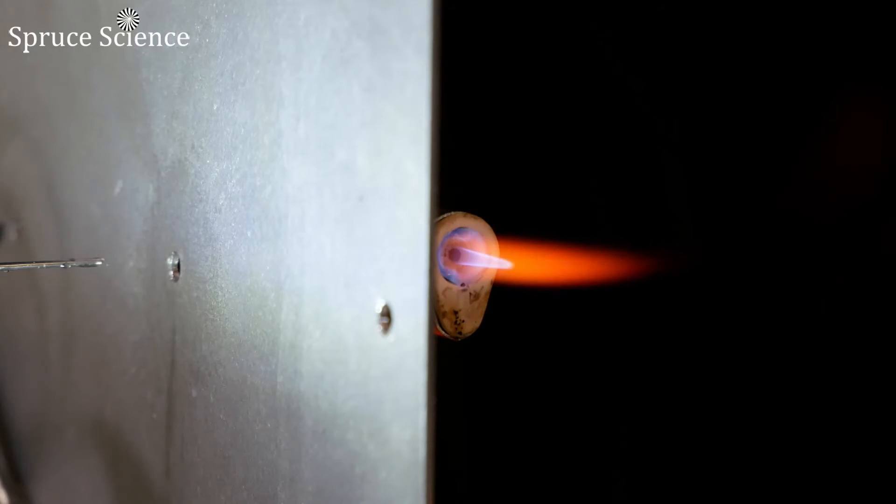In this case, it produces a bright yellow color because the sample I'm using is sodium.